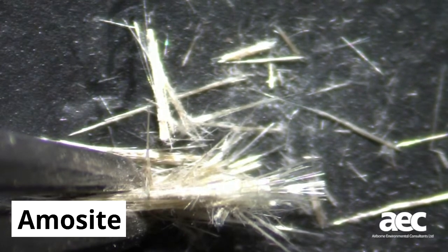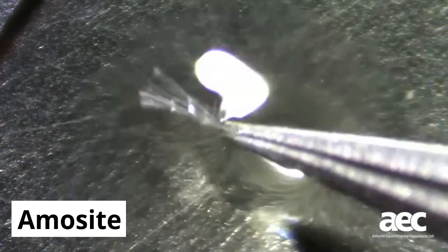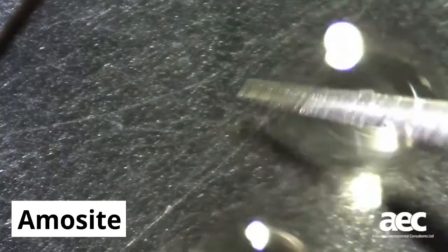These fibres are mounted onto a microscope slide in an oil which shares similar optical properties to that of the suspected asbestos type. This is then assessed under the polarised light microscope by rotating the fibre and changing the settings. This first test searches for pleochroism and relief and would present as a change in colour or the fibre standing out significantly against the background.